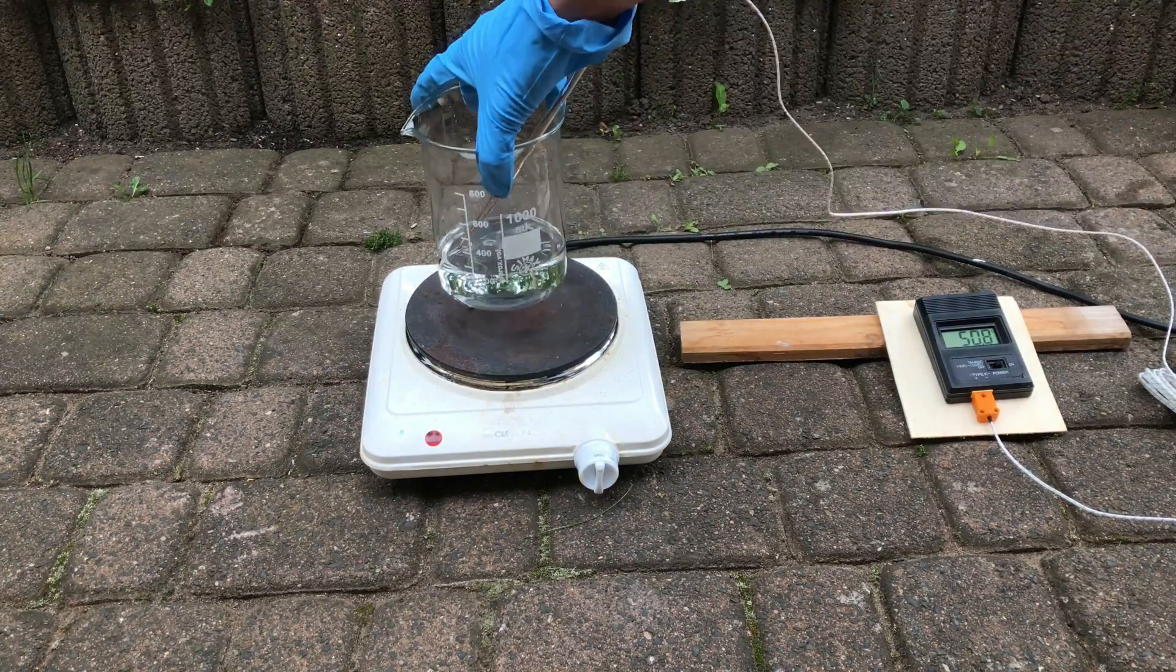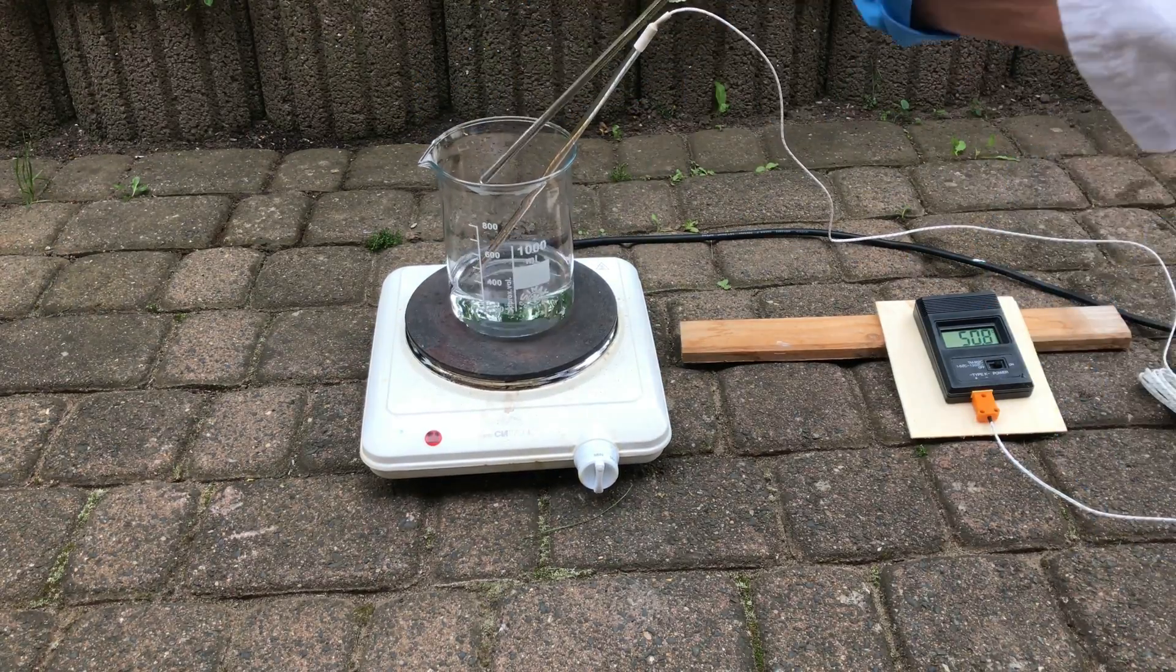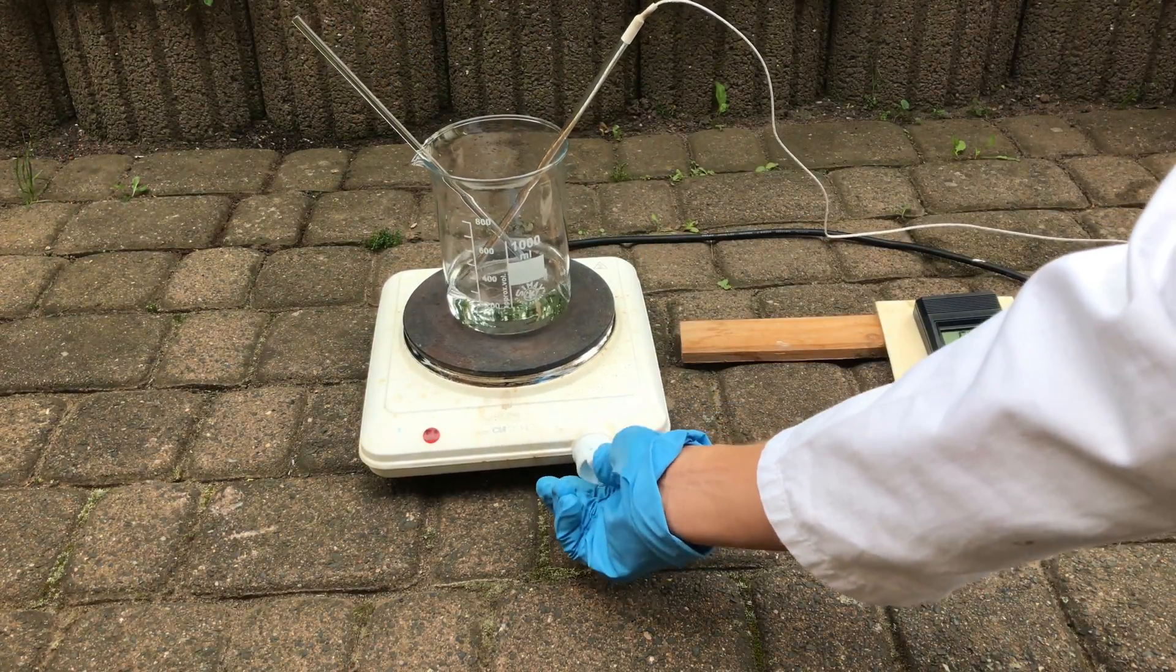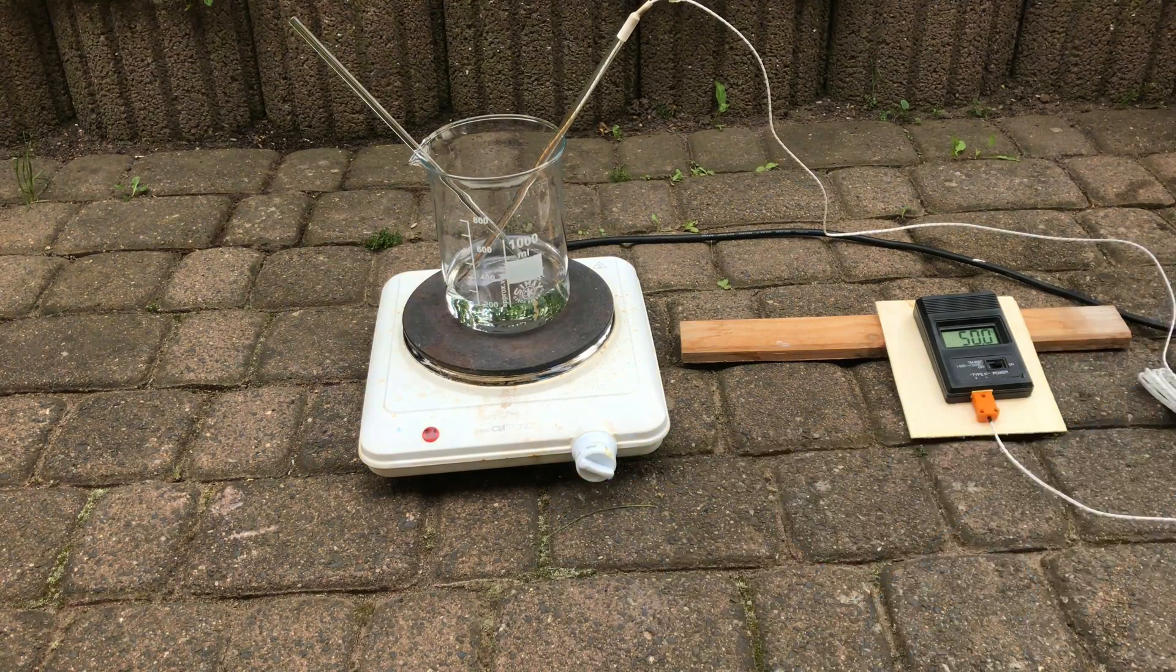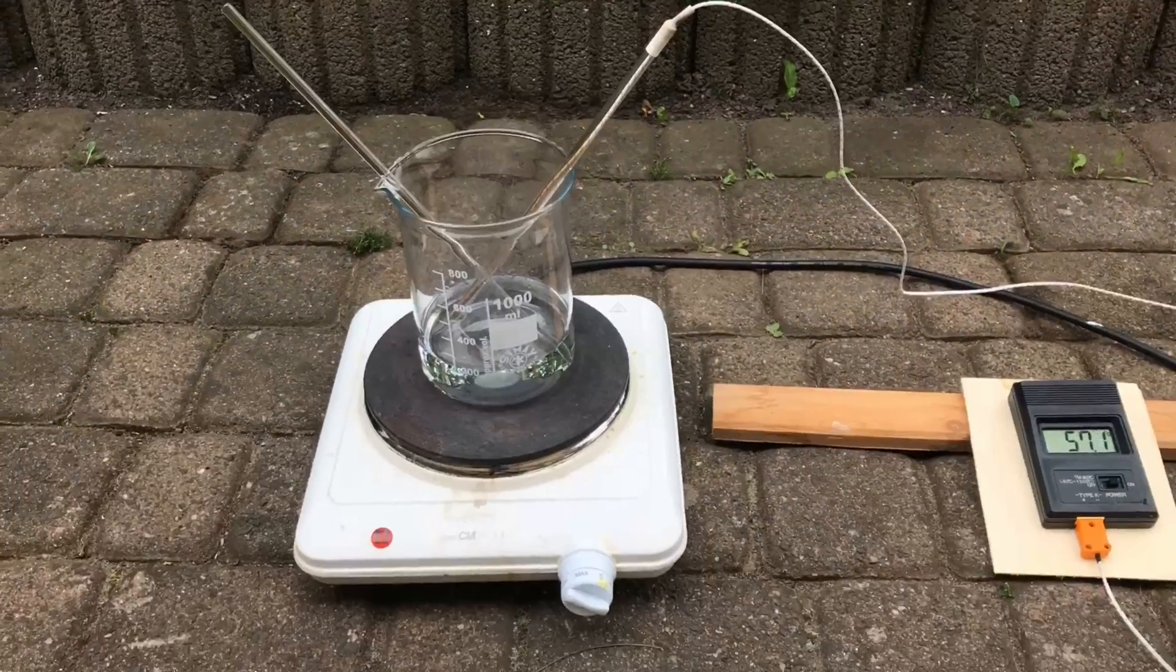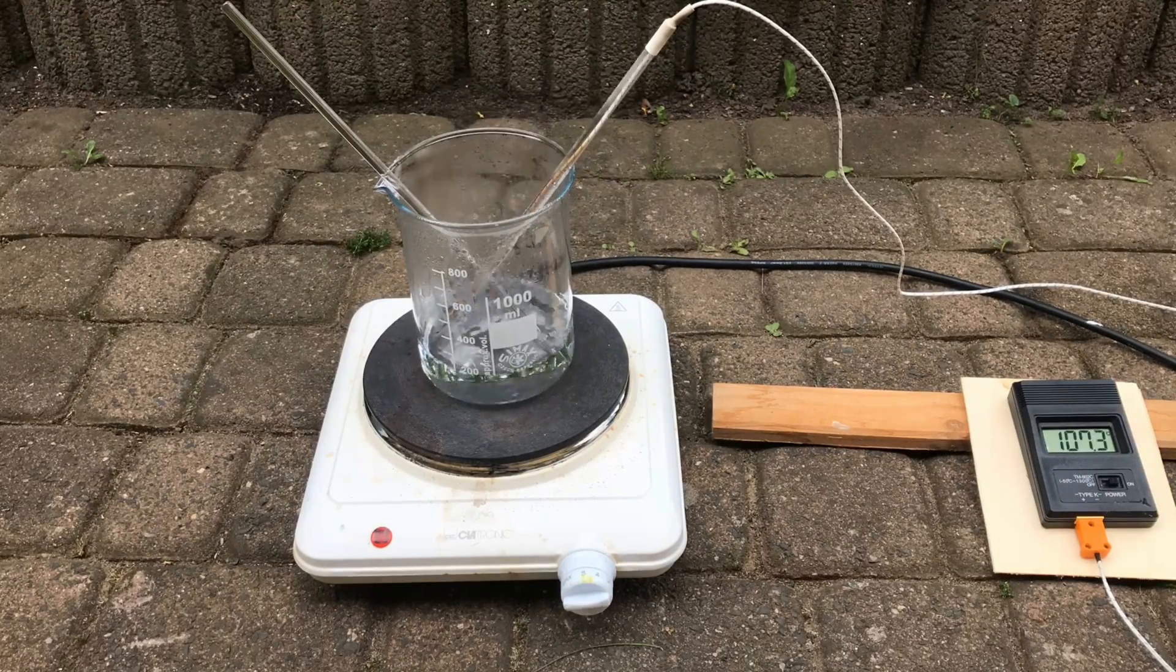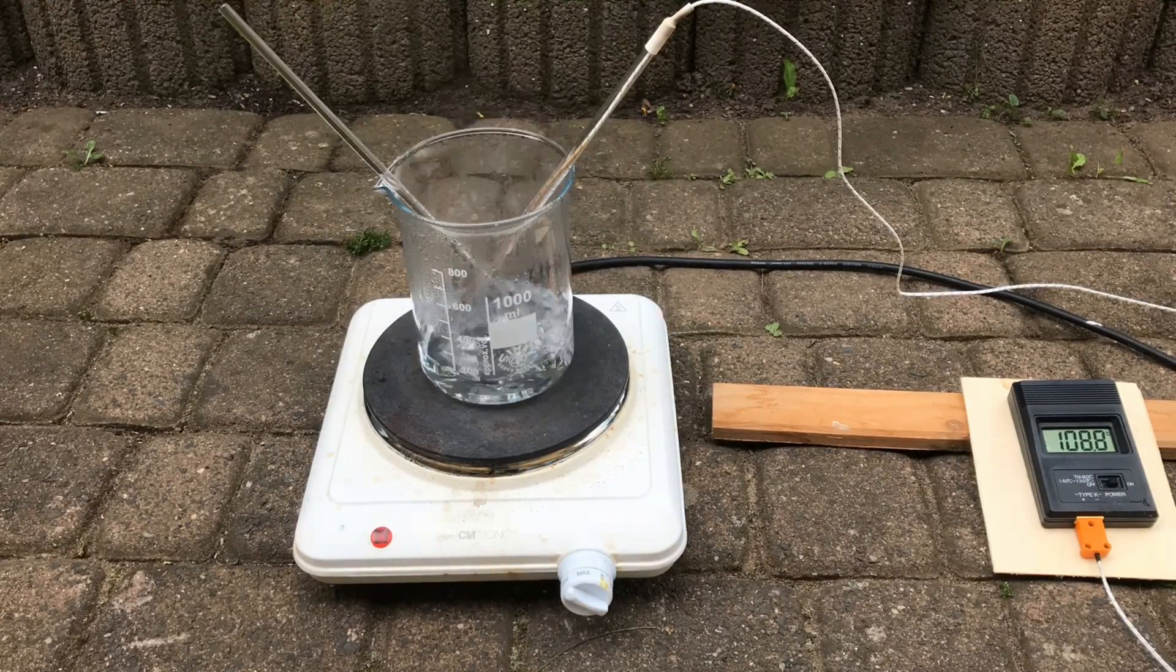Then we took the beaker outside and boiled off most of the water. It is important to keep an eye on the temperature. Above 261 degrees Celsius sodium formate will start decomposing.